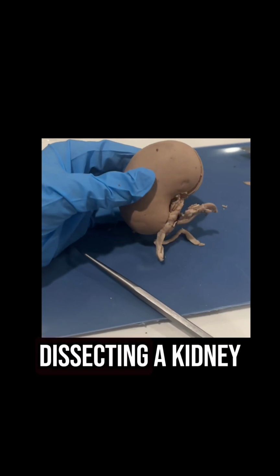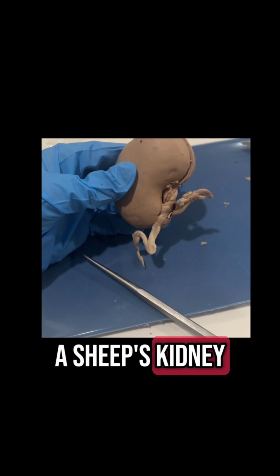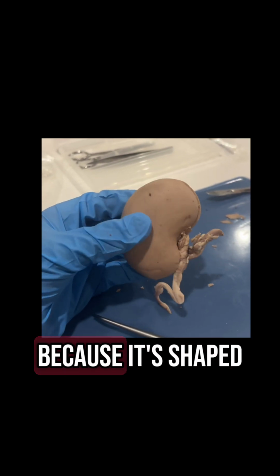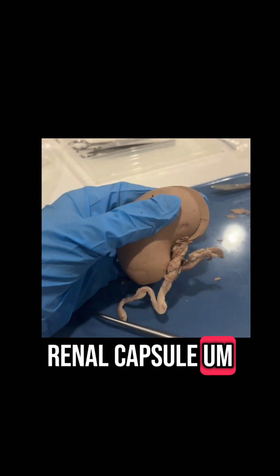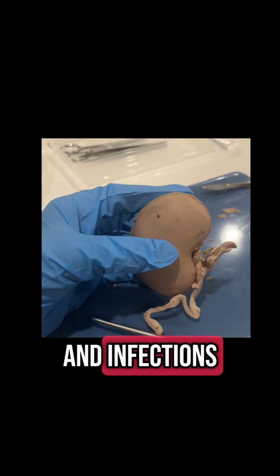And today we're going to be dissecting a kidney and going over the anatomy of the kidney using a sheep's kidney. So just to start off with the external review, the kidney is called the kidney because it's shaped like a kidney bean, and it's smooth. Covering the entire outside of the kidney is going to be the renal capsule. And while this layer is thin, it protects the kidney from damages and infections.